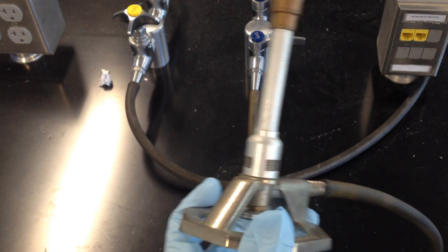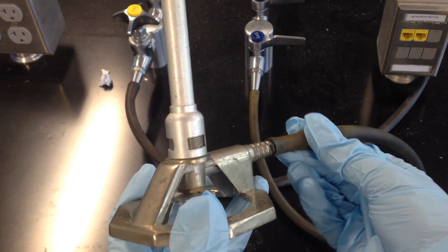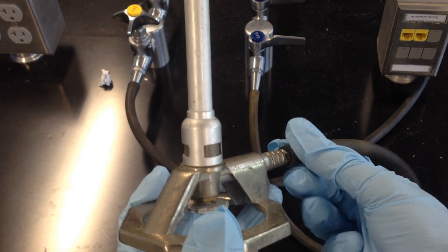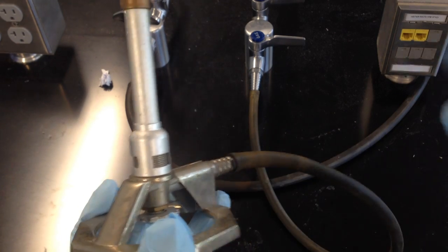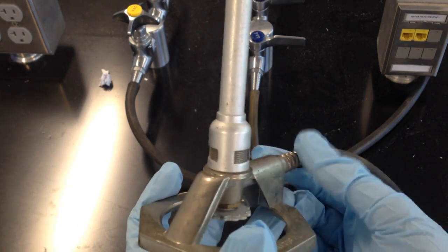The first step of this technique is to make sure that everything is hooked up. You should have a relatively flexible gas tubing that connects the inlet of your Bunsen burner right here to the gas tap on your bench, which is the one that has the blue spout there.